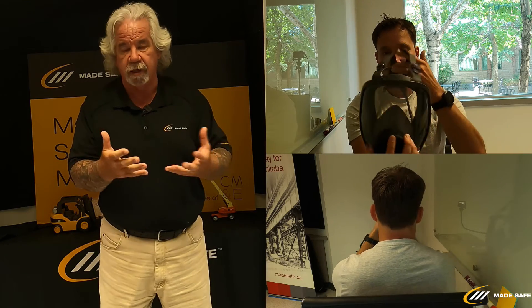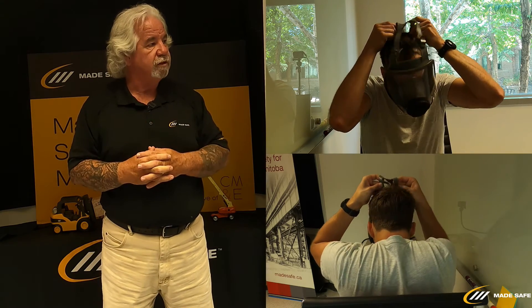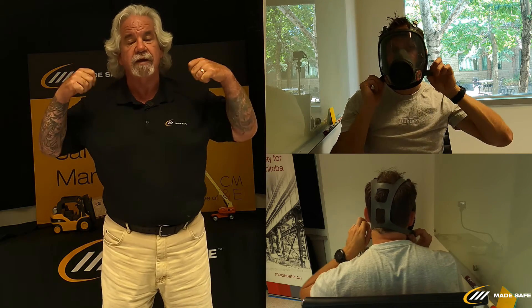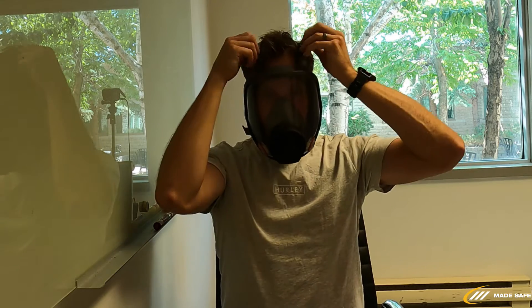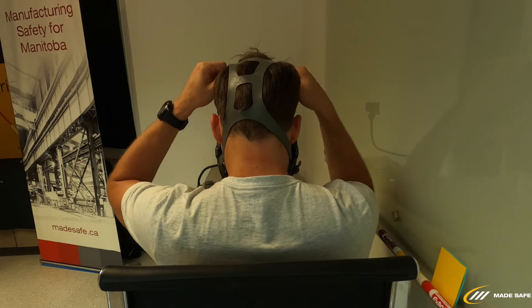For the full face mask, the harness is a little different — it doesn't have separate neck and bonnet sections, just one full section. I'll ask Reg to put the mask onto his face, pulling the harness over the top and bringing the mask down into a comfortable position. Then he'll tighten the chin straps as well as the straps on the top of the forehead, snugging all of them down until he has a good seal.